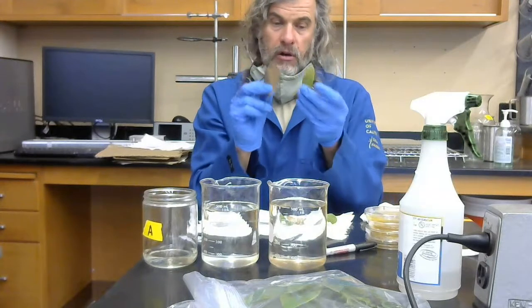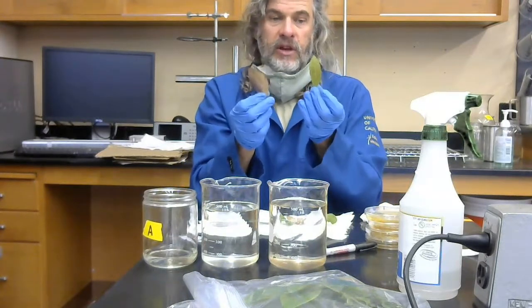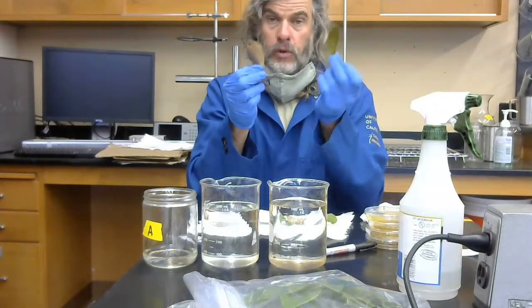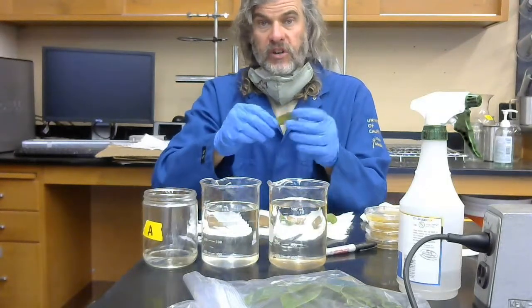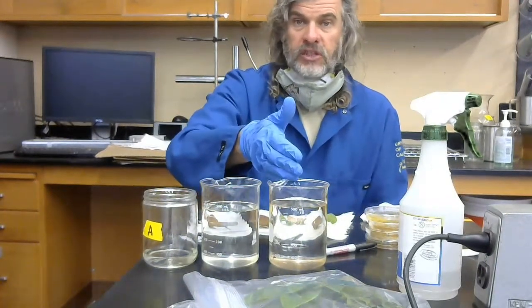We're going to limit our inferences. Sometimes they are, even though they're on the surfaces, but we're going to limit our inferences to things that are actually growing within the leaves, within the intercellular space, or in the cells of the plants themselves. So the way that we do this is we surface sterilize in 2 steps. First is a 10% bleach solution.